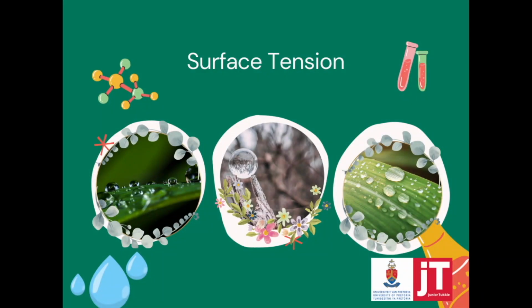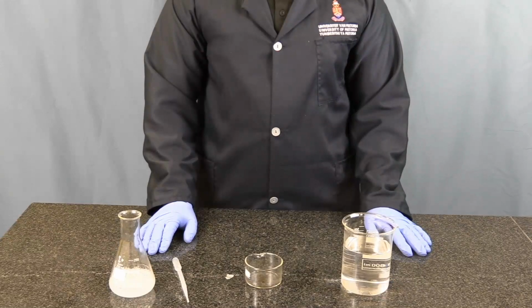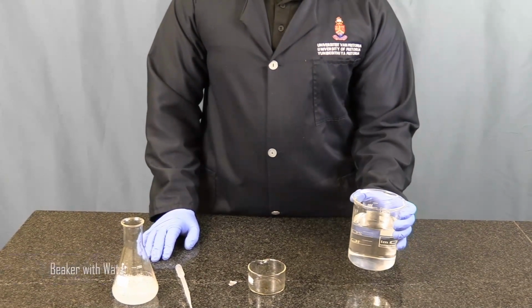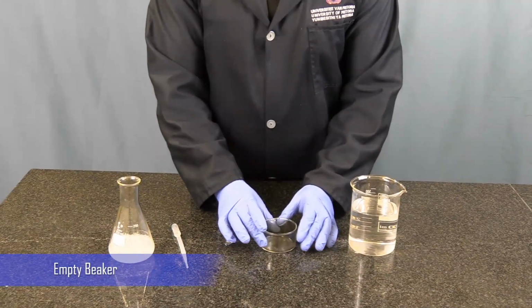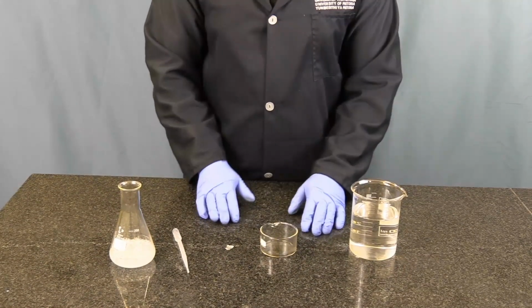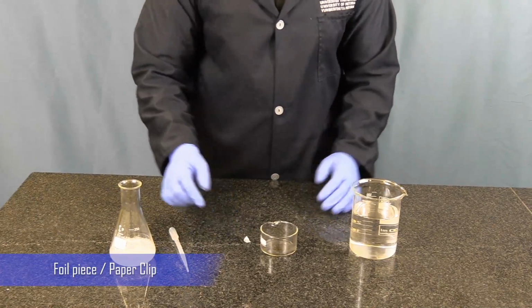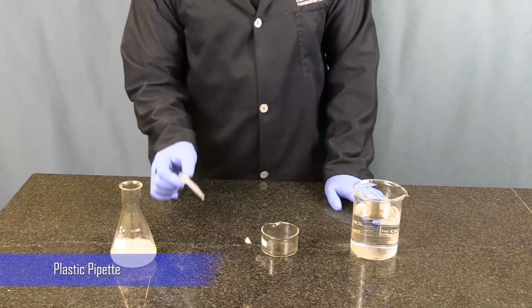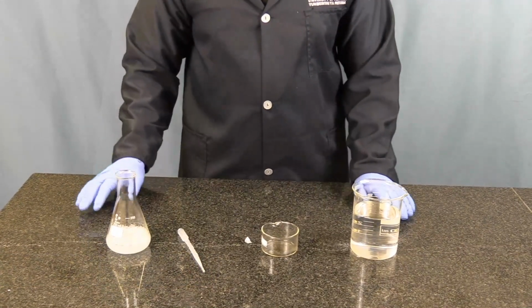Now let's move on to our next water property, surface tension. So we need a beaker of water, an empty beaker, preferably one that is more widely open so that you can see exactly what's happening. You need foil, or at home maybe if you have a paper clip, that could also help, a plastic pipette, and pre-mixed soap.